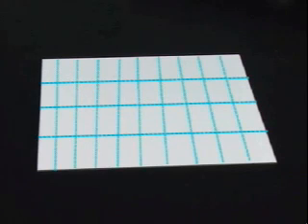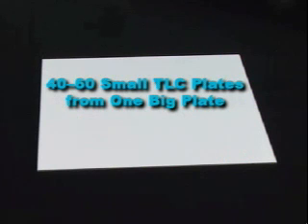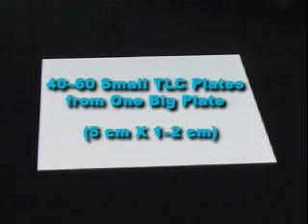Unlike plastic plates, glass plates are generally purchased as large squares, approximately 20 centimeters by 20 centimeters. This means that it's up to you to cut the plate into smaller plates of usable size. With a few well-placed cuts, you can generally get approximately 40 to 60 small plates from one big plate. The small plates are commonly 5 centimeters long and about 1 to 2 centimeters wide. Cutting glass TLC plates without breaking them is something of an art. It will take some practice, but here are a few tips to get you started.